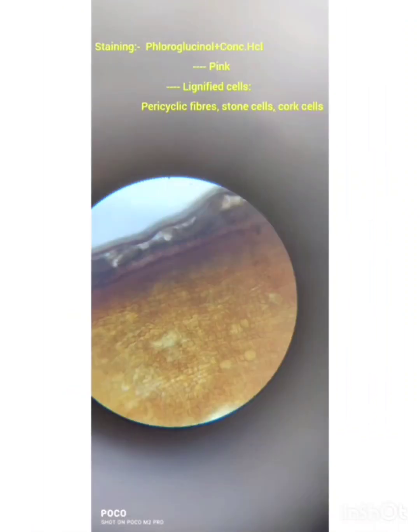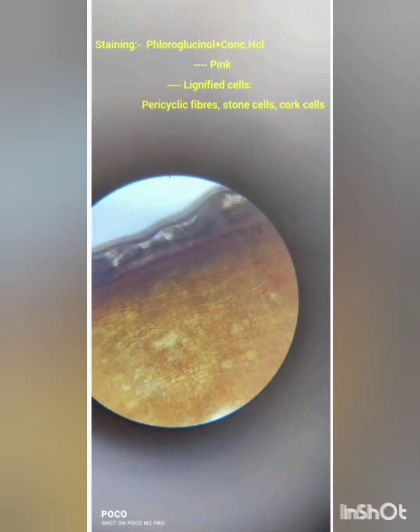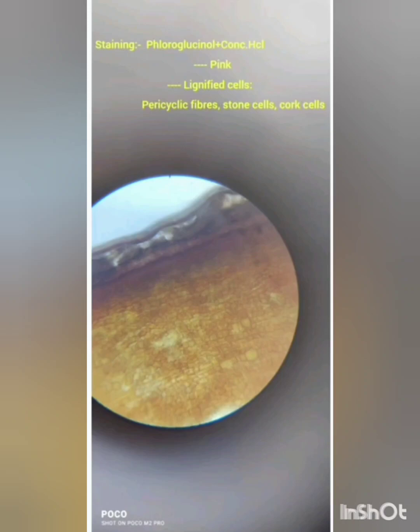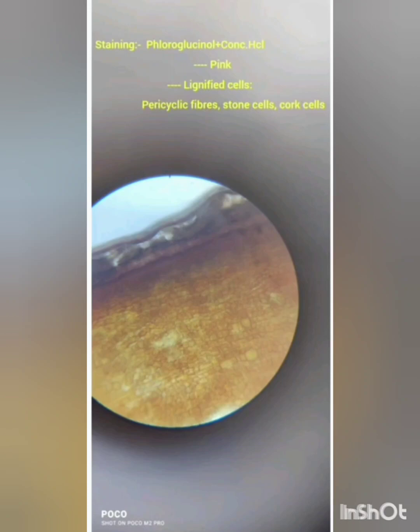The same procedure is followed for phloroglucinol plus concentrated HCl solution staining. This is the transverse section of cinnamon bark after staining with phloroglucinol plus concentrated HCl solution. It shows pink or fuchsia color, which indicates the presence of lignified cells, pericyclic fibers, stone cells, and cork cells.